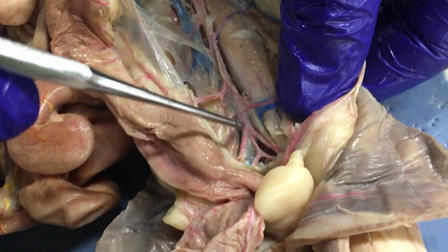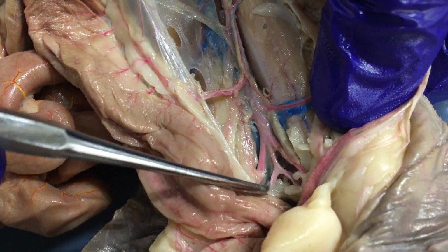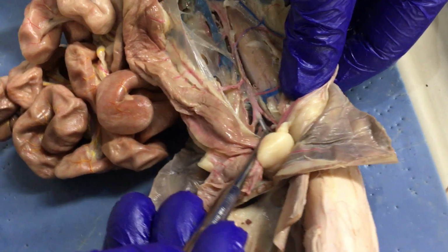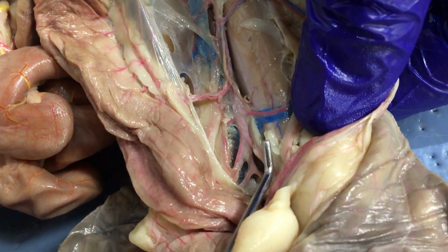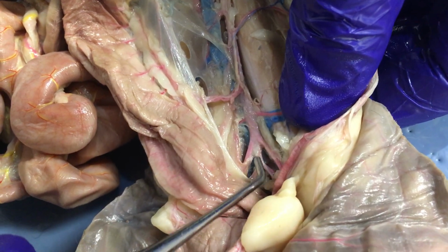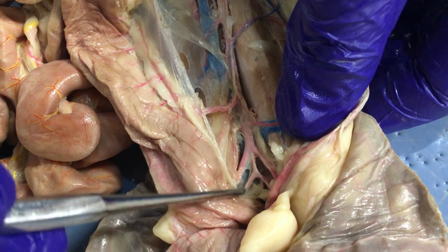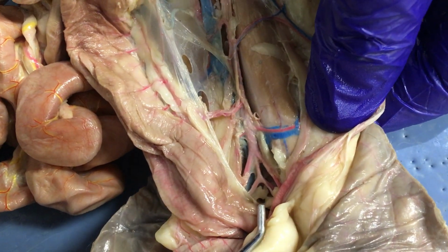And then the aorta finishes by dividing into two sets of iliacs. The first ones here, the thicker ones, the first ones that branch, are the external iliac arteries, and then the aorta goes a little bit more, and then two little internal iliac arteries down in the pelvic cavity.